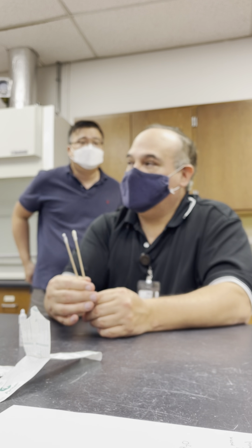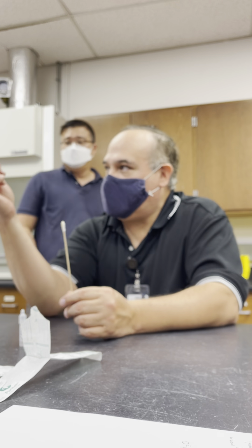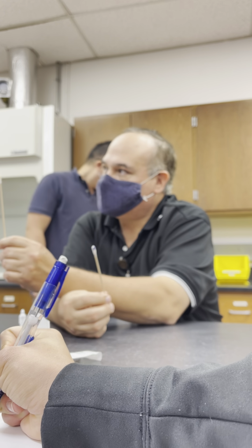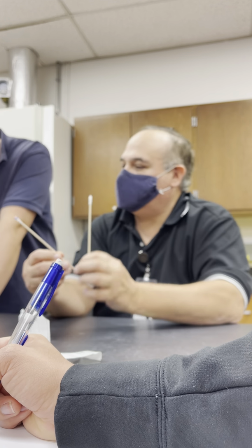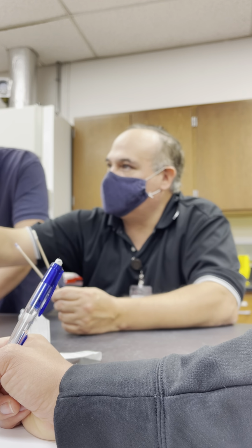Picture. What were those two organisms? I got it. So this is Alcaligenes faecalis. It's a positive one. And this one was Proteus mirabilis, but it would represent anything that's enteric. So we could say it would be close. You could say it's E. coli if you wanted to, but it's Proteus. This is the one that she picked. These are all in the same category. These are all enterics.